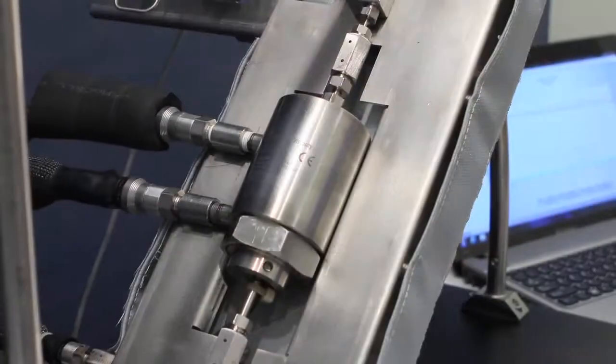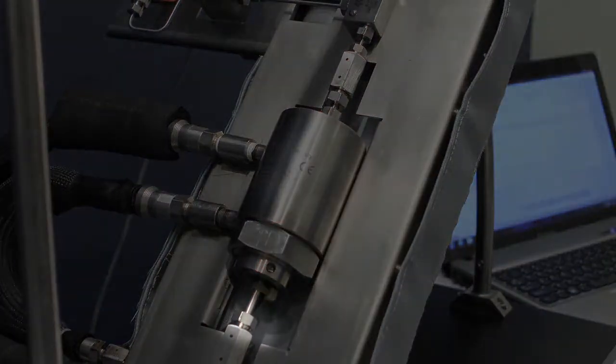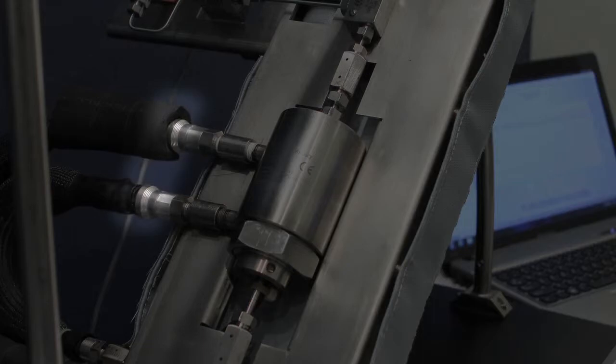If more extensive cleaning is required, the sensor can be completely removed by loosening the joint below the sensor and pulling back the quick disconnects connecting to the jacket.